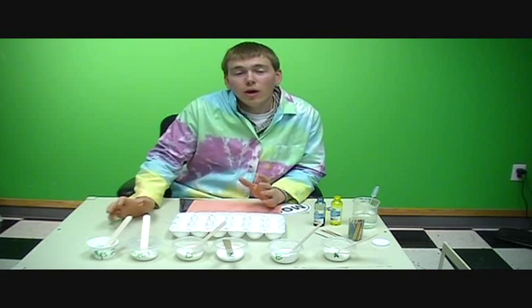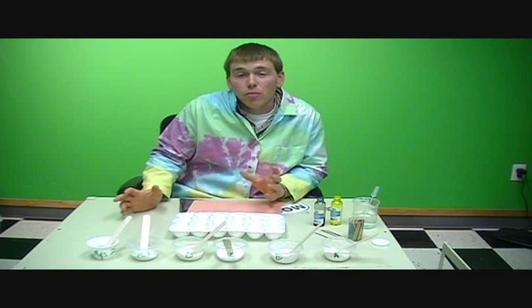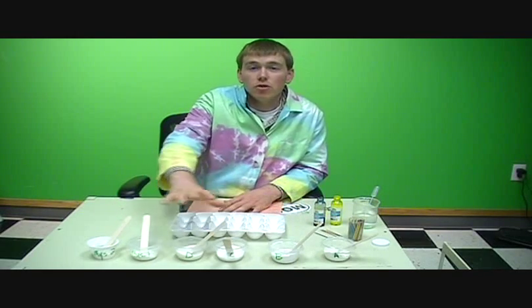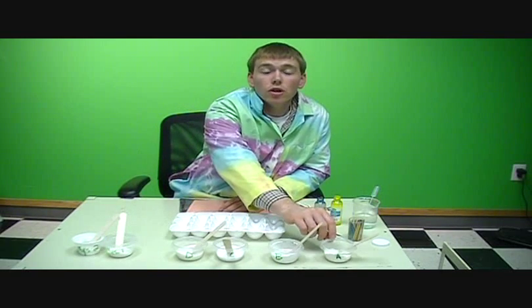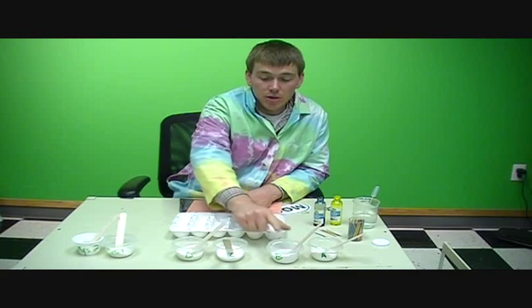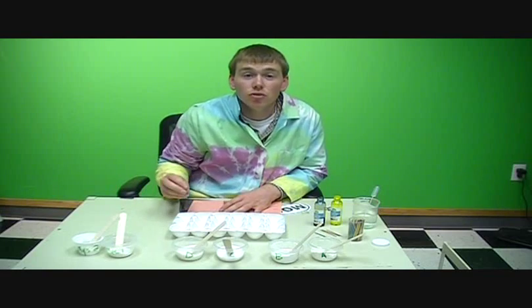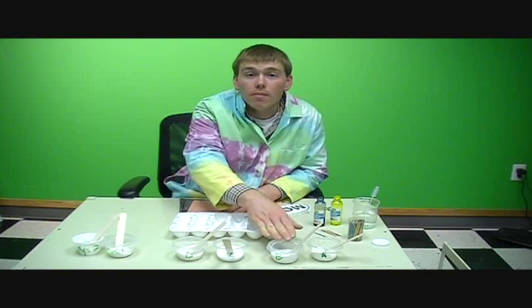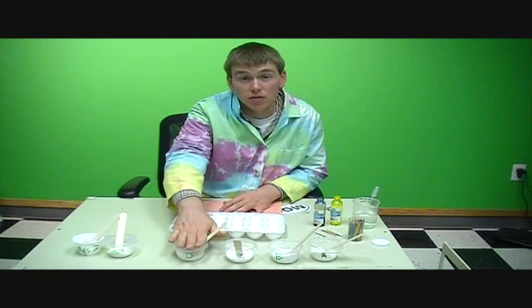And so what students will do, after we go over a little review of chemical and physical changes, is work with another person in a team of 2 to solve this crime. And basically the crime involves these mystery powders. We'll start off by giving students 4 known powders, A, B, C, and D. And these powders represent dandruff collected from the 4 suspects: Mr. Mansfield, Grandma Mansfield, the daughter Susie Mansfield, and the son Dudley Mansfield.